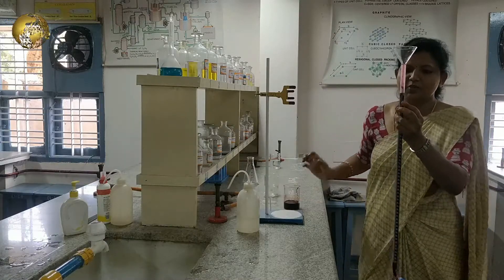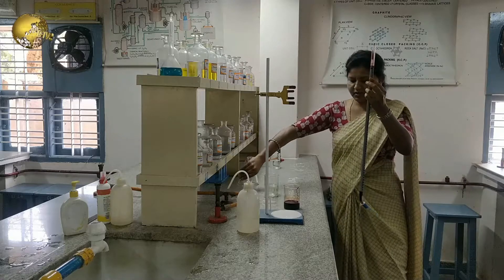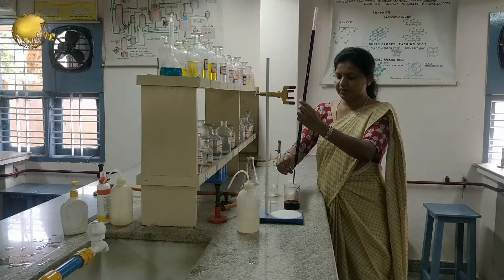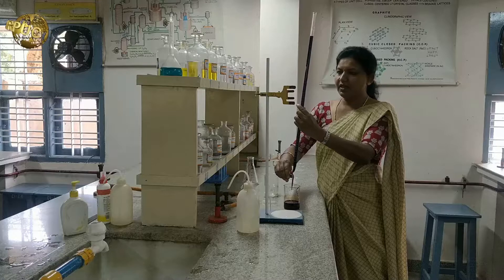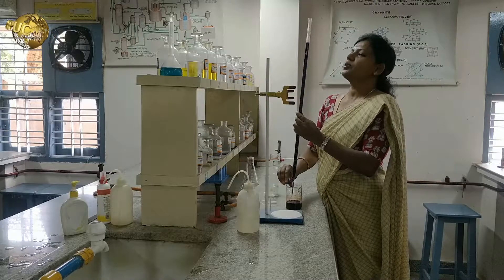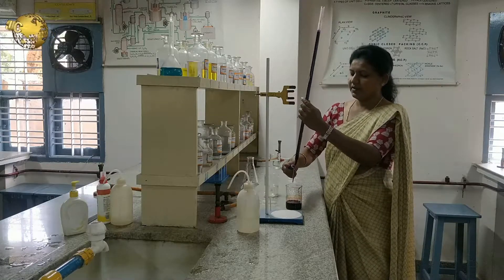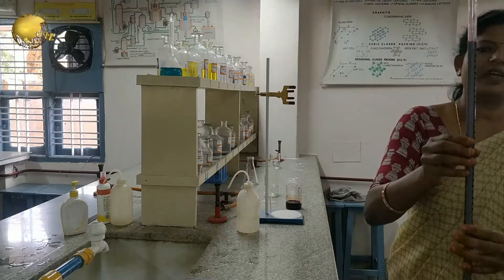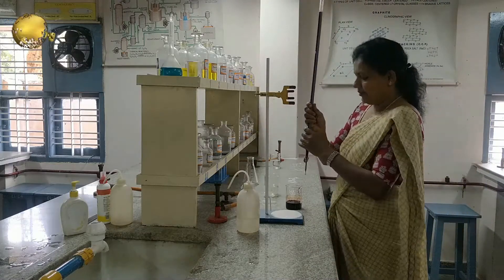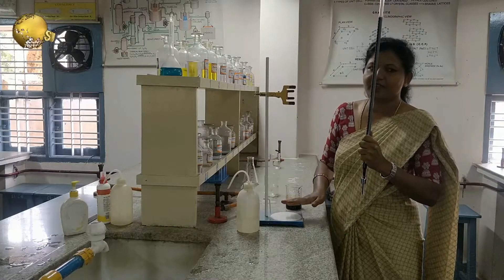I am filling above the zero mark and removing the funnel from the burette. Whatever air gap is there at the nozzle, we have to fill that by opening the tap. We adjust to the zero mark, taking the upper meniscus of the solution because for colored solutions we have to take the upper meniscus. The burette is fixed to the burette stand which has a white background, so color changes will be clearly visible.